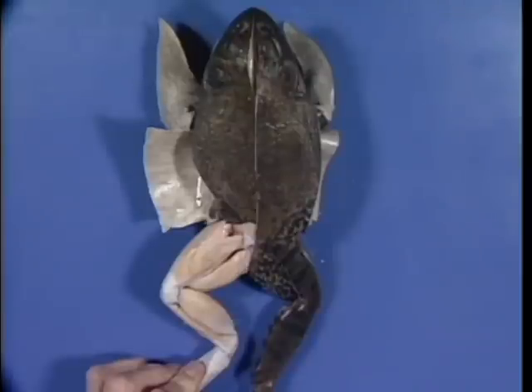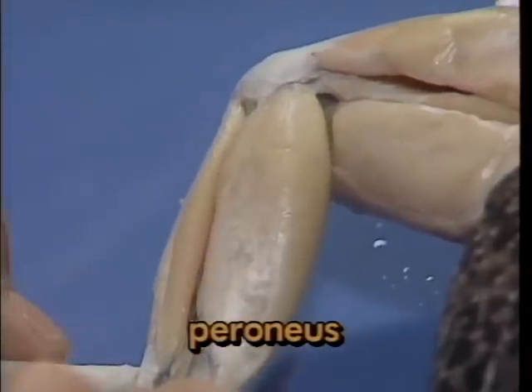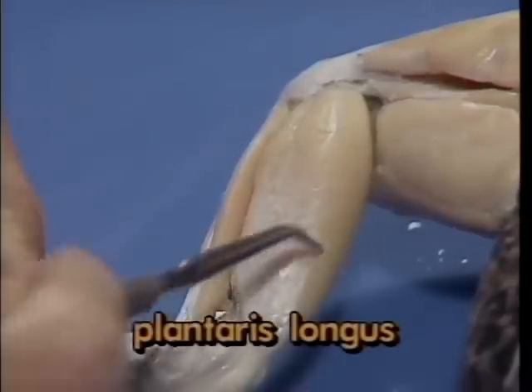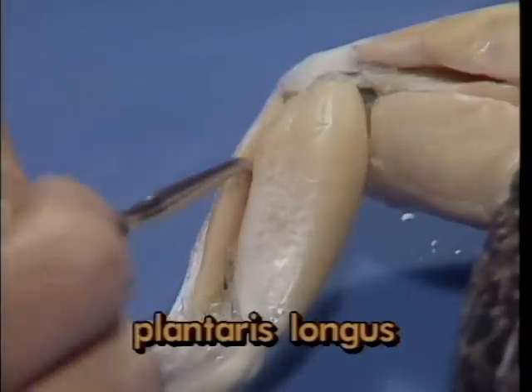Two well-defined muscles complete the shank or lower leg. The smaller lateral one is the peroneus, which helps extend the lower leg from the knee. The larger, more medial one is the plantaris longus, seen here from the dorsal view.